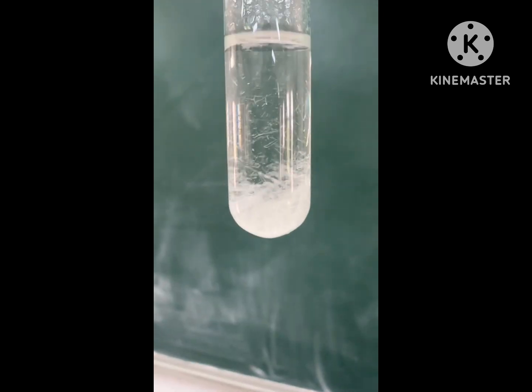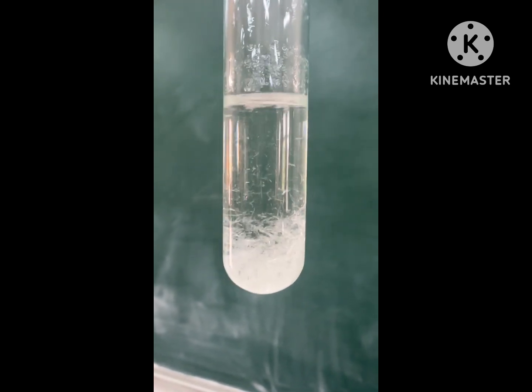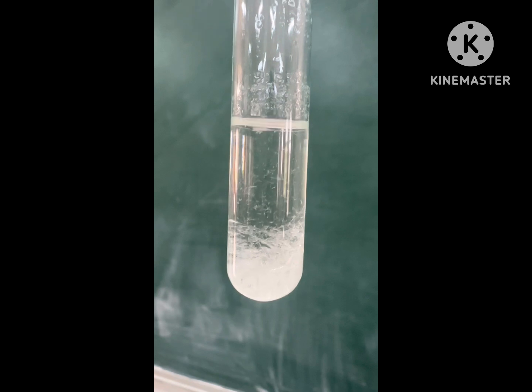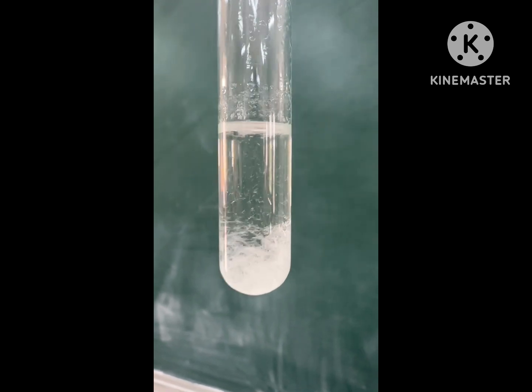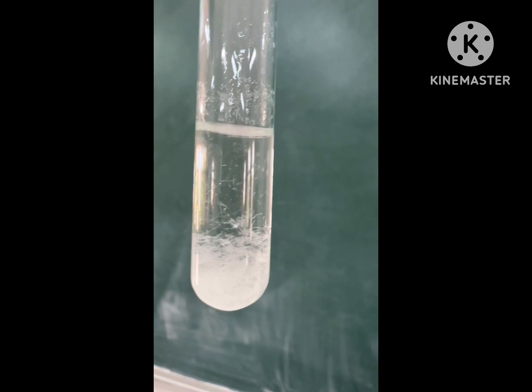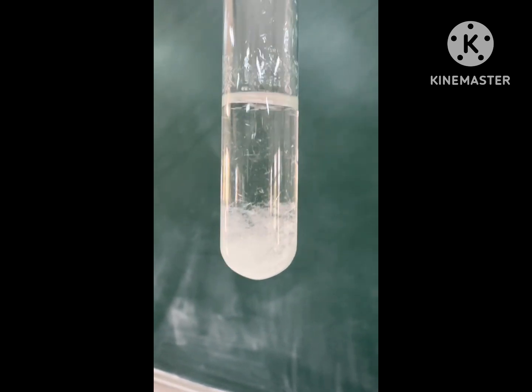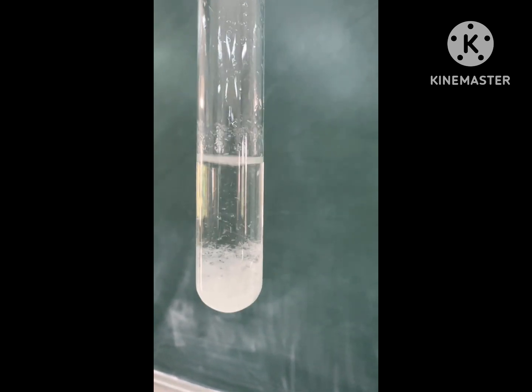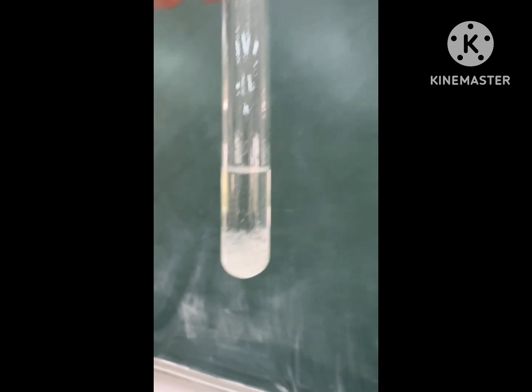And crystallization is taking place, the crystals are forming in the test tube. You can see how the crystals are appearing. Crystal formation is taking place.